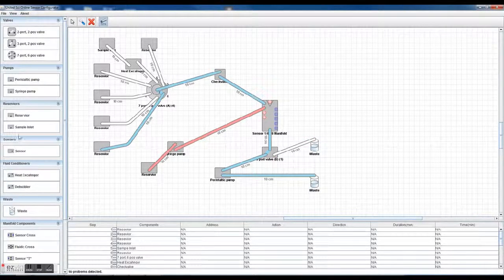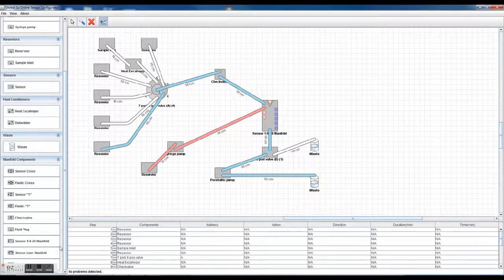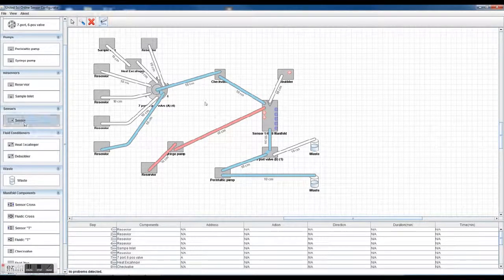You can add in, for instance, a debubbler. Where would my debubbler be? Right up here. And make and break a fluidic connection. This always is a debubbler on the top. And then here's the most important part. Here you can have various sensors in the sensor array. Sensor 1, sensor 2, sensor 3. Let's just do a 3 sensor array. You can also add in here a standard leak sensor.